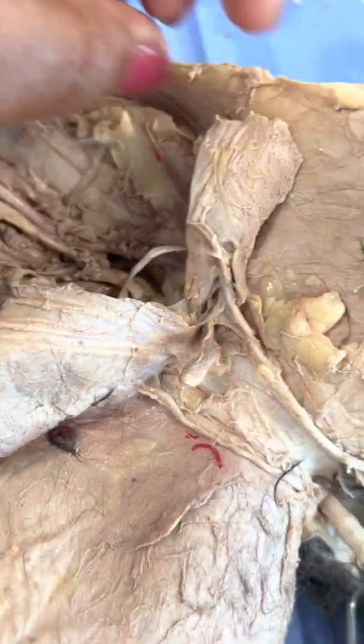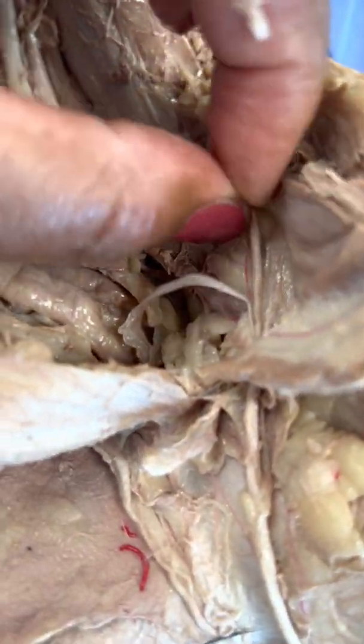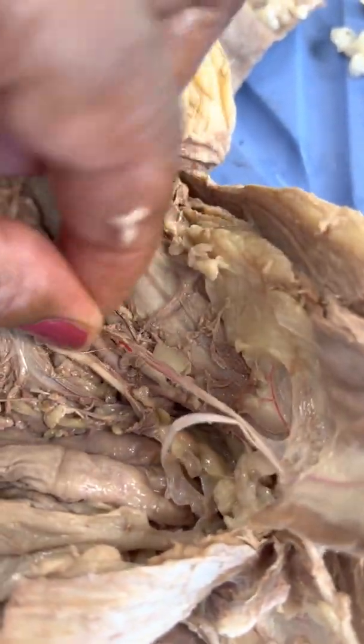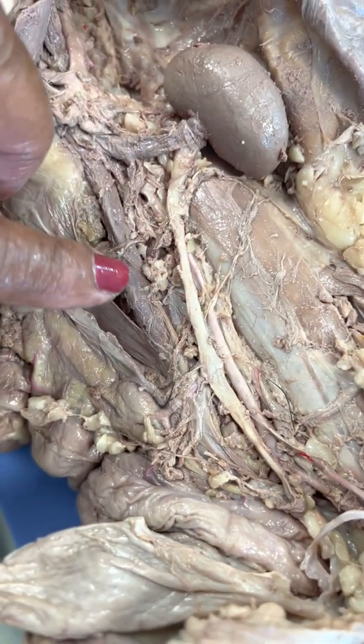And also, I was able to tease out at least the artery here from the spermatic cord. And you can see here the testicular artery coming here along the wall. I know it's this, and I broke it, but it would have been coming off the abdominal aorta. You know that's the abdominal aorta, and that's the inferior vena cava.